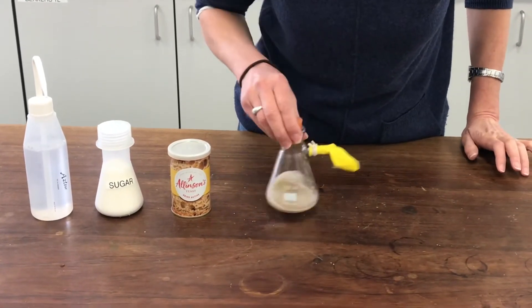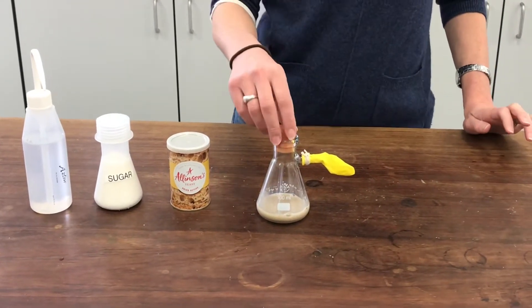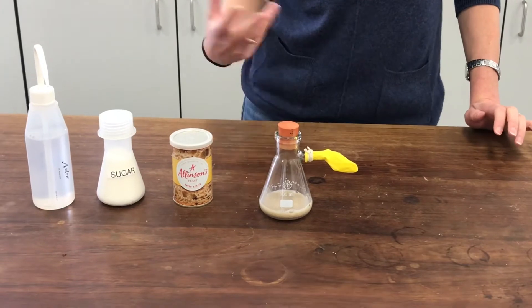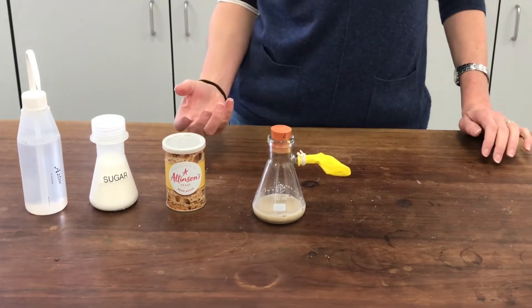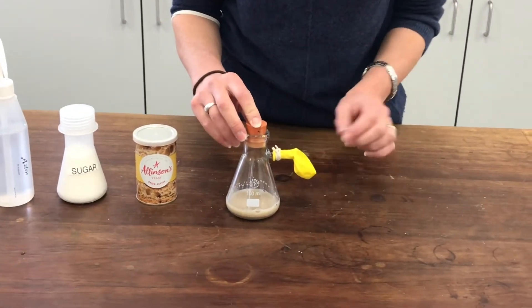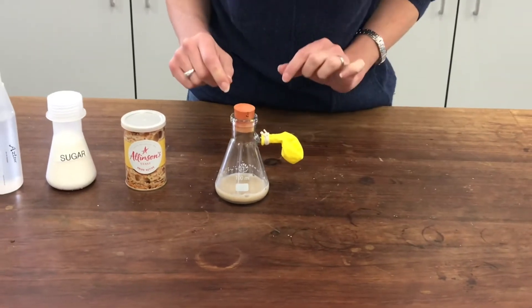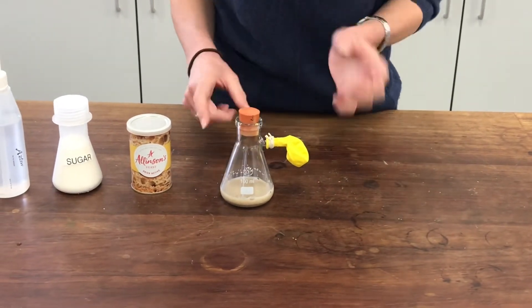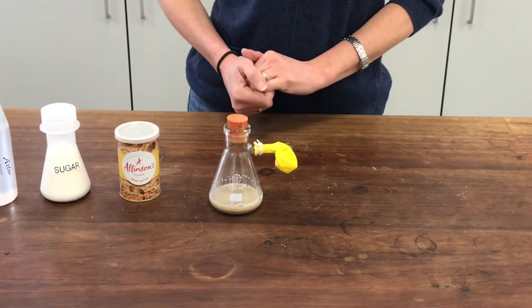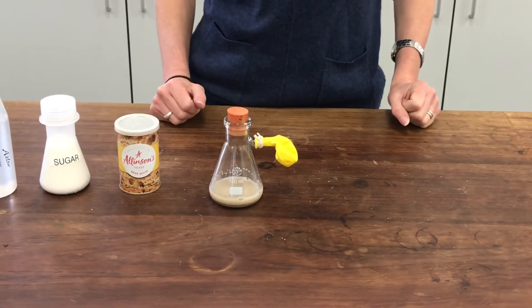So this process is actually to model fermentation. I've got to leave it for a little while and let it get warm so the yeast can work most efficiently. I'm hoping that the balloon I've attached on the side here is going to start to inflate to show the carbon dioxide that has been produced while the yeast has been respiring anaerobically and fermenting the sugar into ethanol.